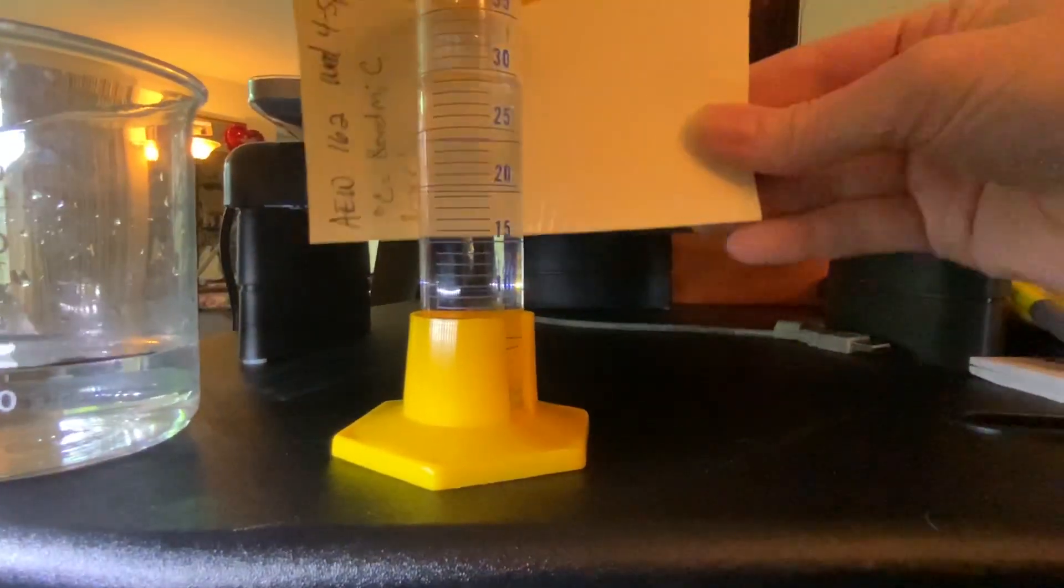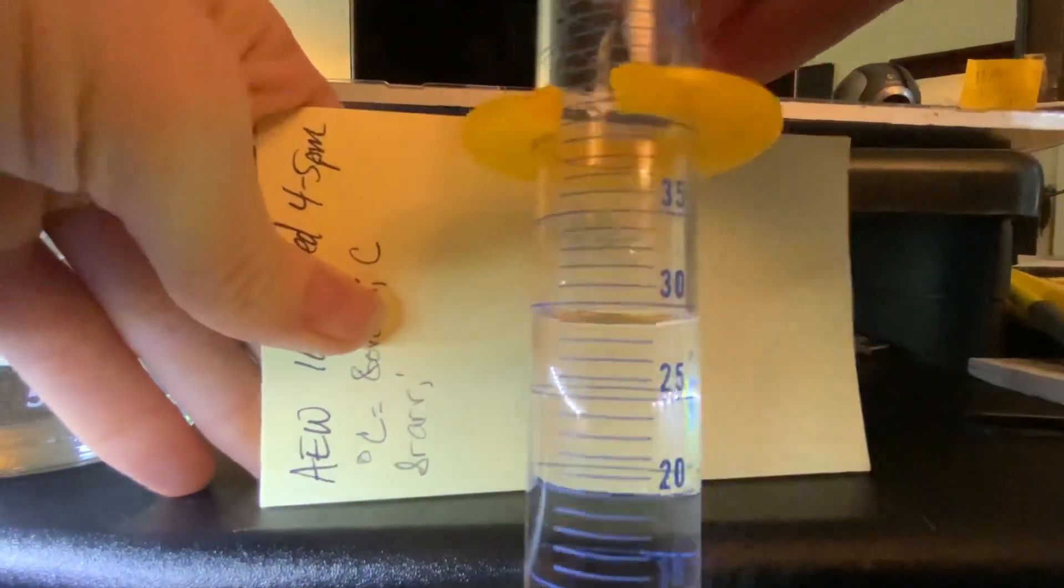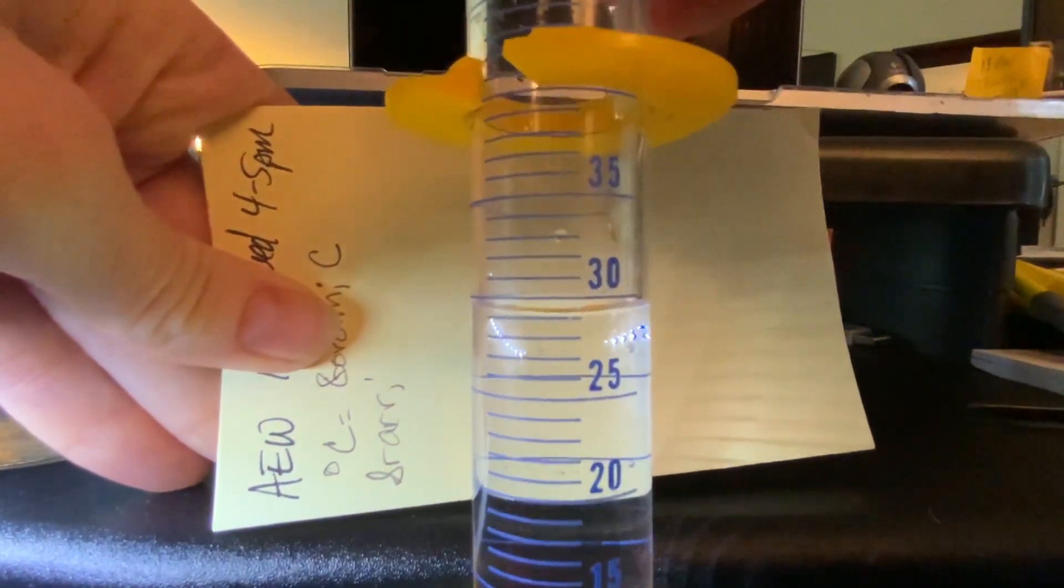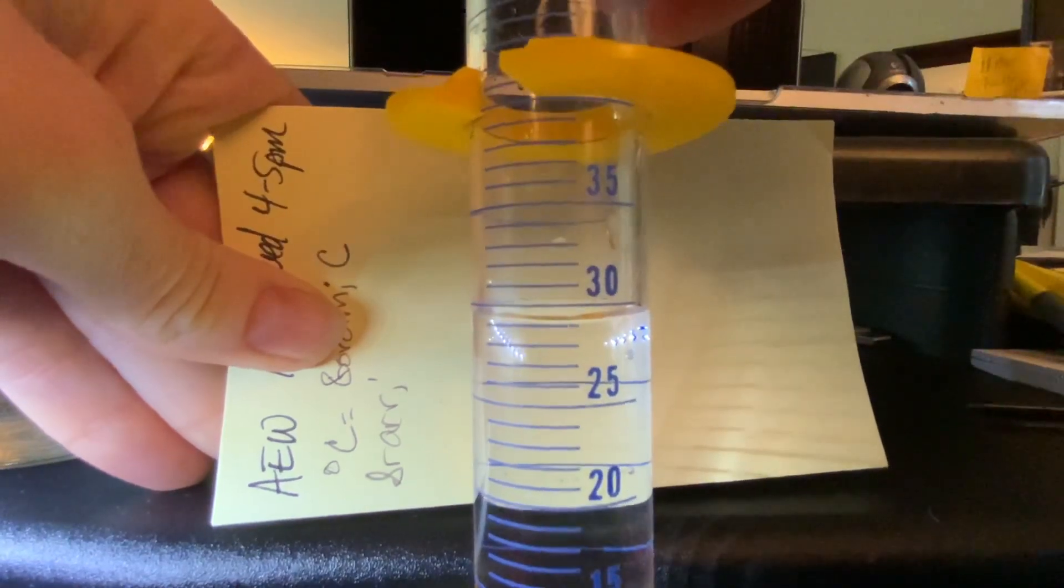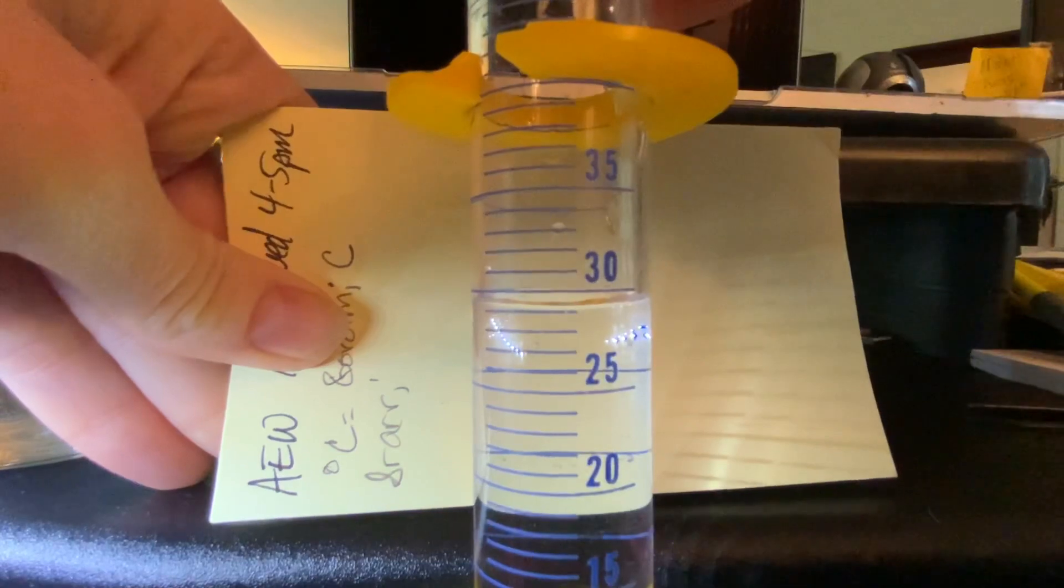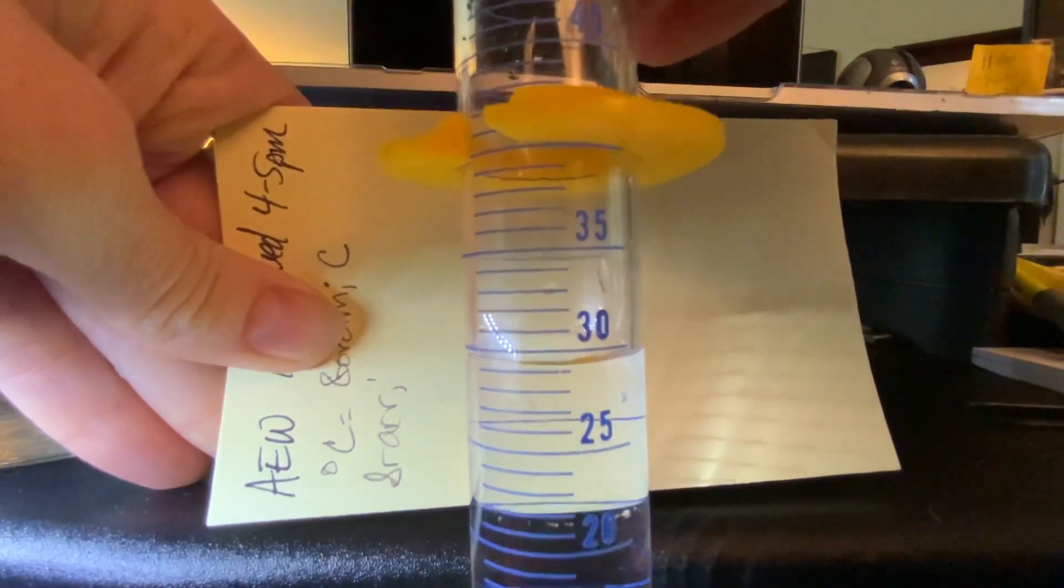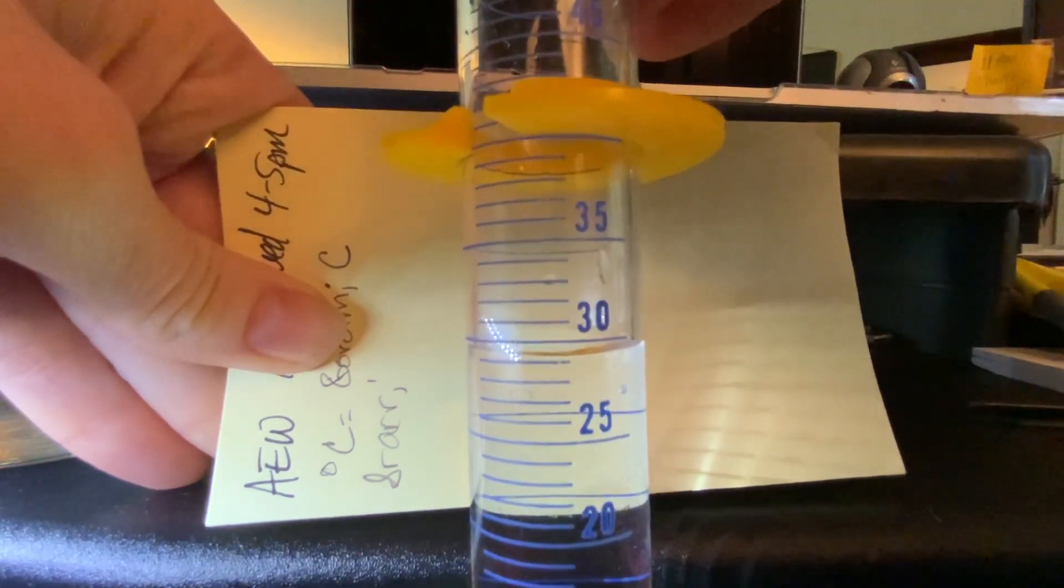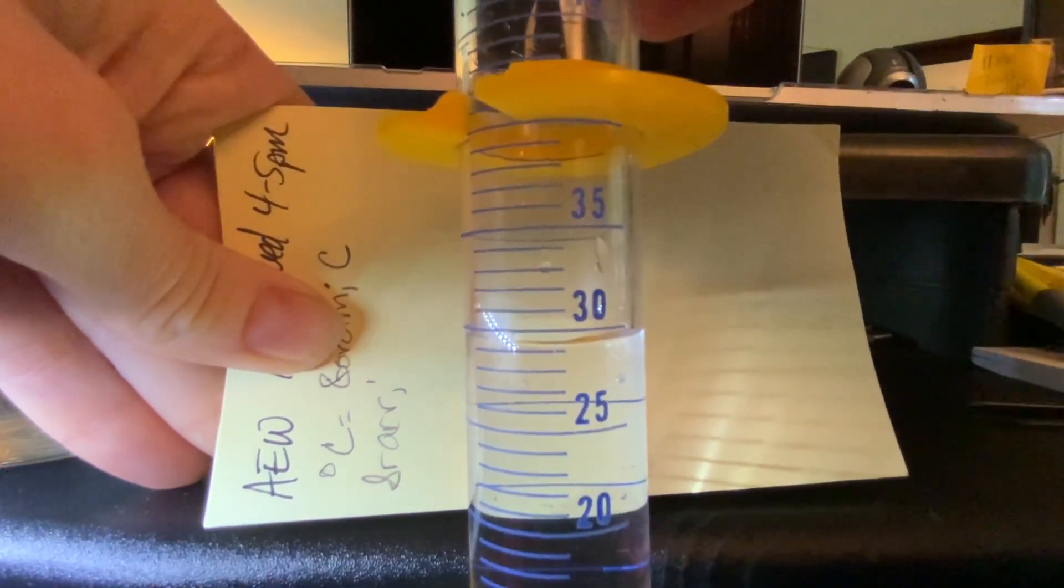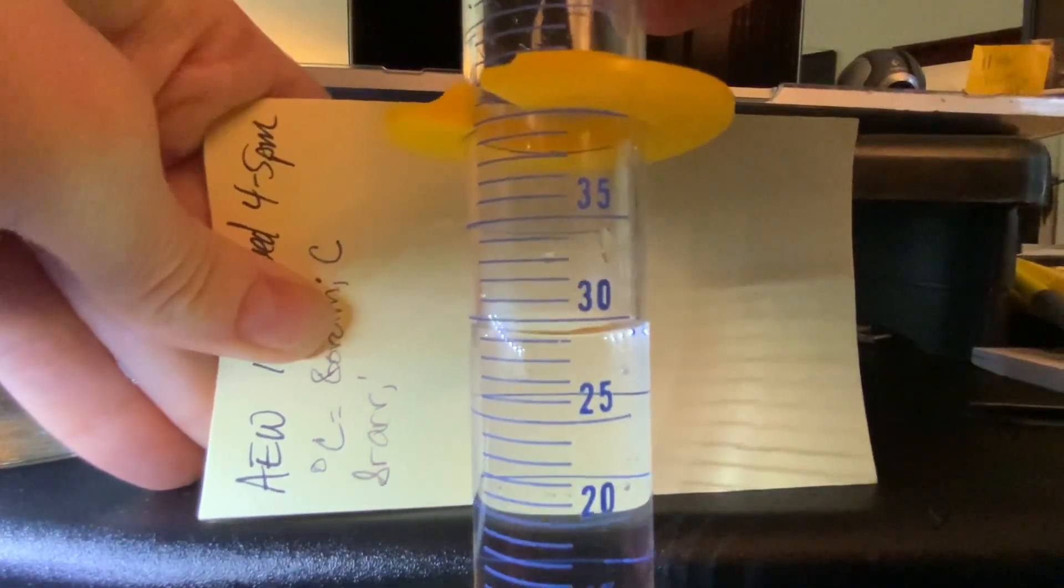Now I'll need to read that straight on. Yeah, that's pretty good. Looks like it's just above that line. Make sure that you read to one tenth of the smallest markings from the bottom of the meniscus.